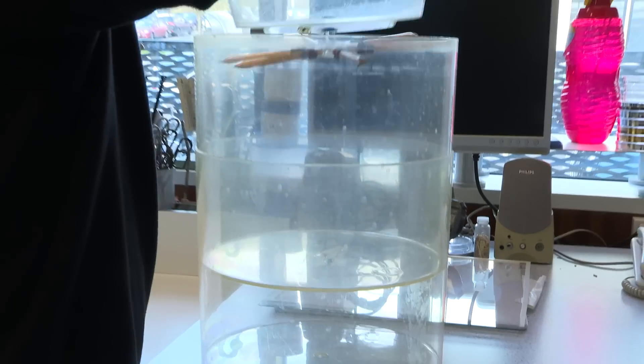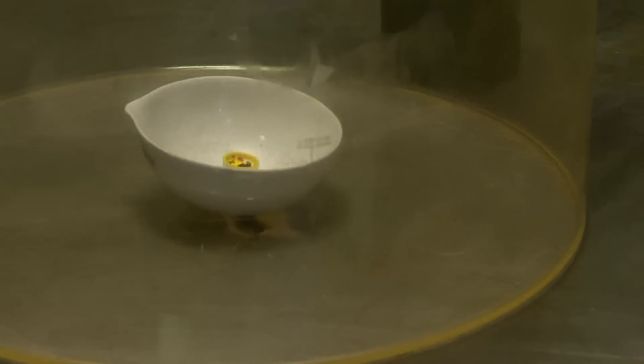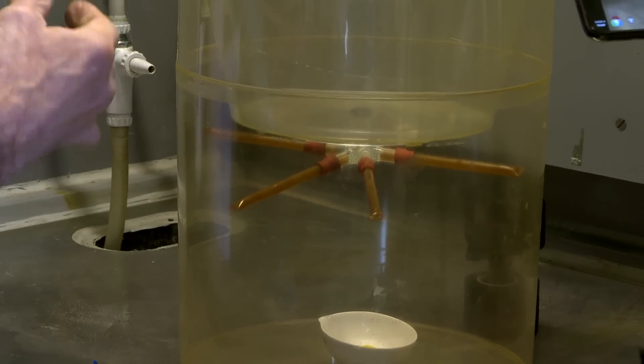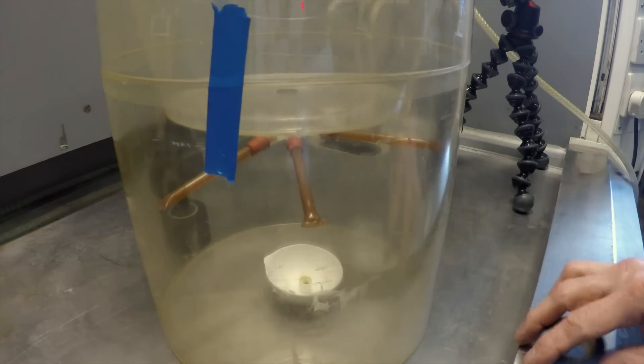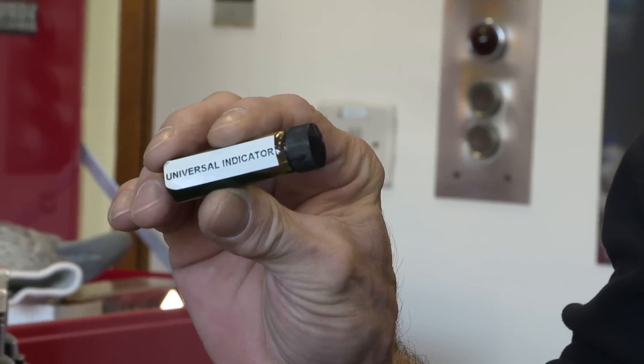The experiment consists of a large container in which you can burn sulphur to generate SO2 or SO3. It then has a vessel on top in which you can put water, and the water is sprayed out of some glass arms so you get rain going into the gas. The problem is you can't see whether the water has become acidic if you just use plain water, so you have to put in an indicator.